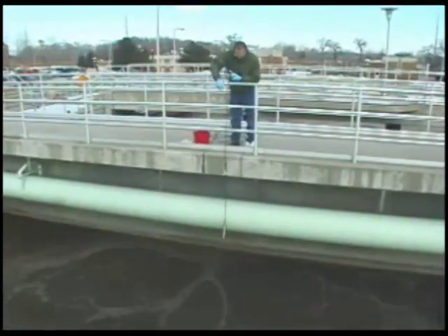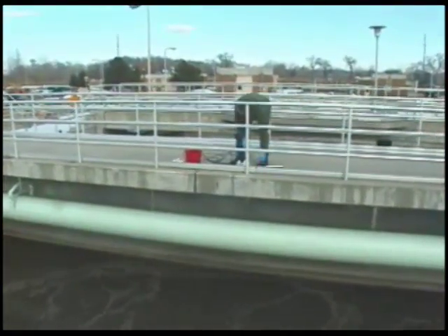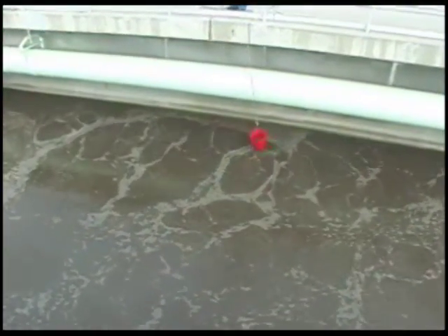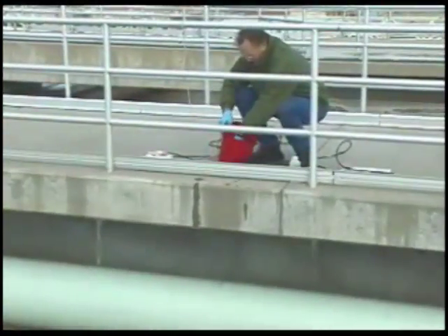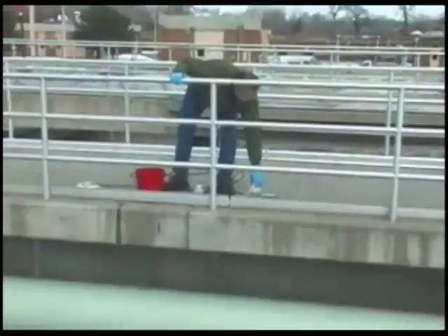Following the initial measurement, a grab sample is required from the exact location where the measurement was taken. Each different type of sample matrix within a plant may have slightly different nuances, and this difference needs to be calibrated within the suspended solids calibration. The sample is collected and sent off to the process control laboratory for suspended solids determination.